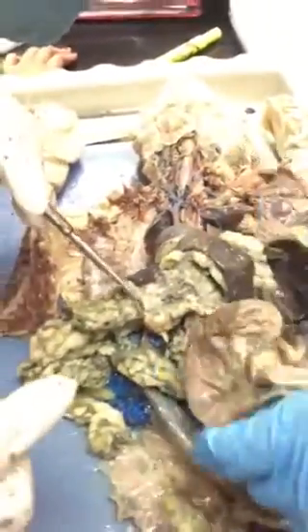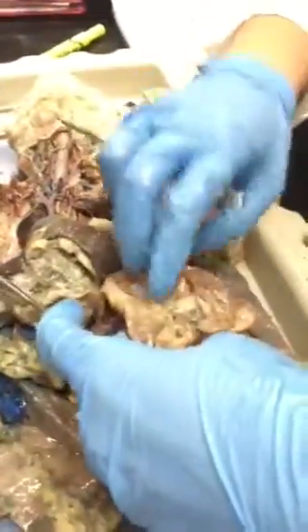If we look through the small intestine, the thicker looking ones are small. Thicker than what? The big one is bigger. This is your large colon. You're gonna study this later. Our small intestine's just huge. They're much longer than the large intestine. That's why I was like, that looks so short. I didn't even think that was the intestine. I think ours just has so much fat in it.